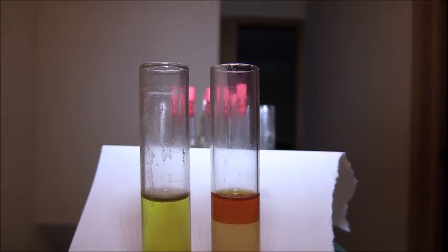I put this in a test tube, I let the liquid portion separate from the sediment, and then I poured off the liquid portion.